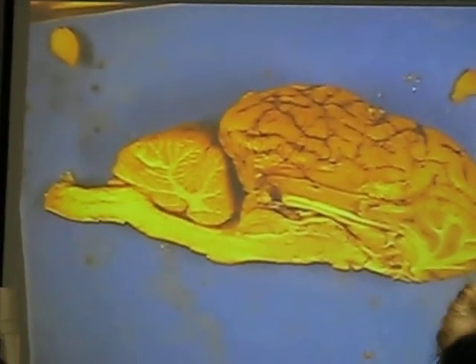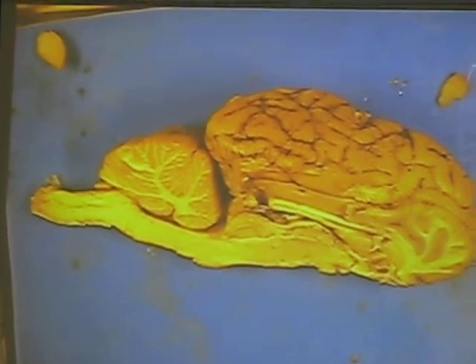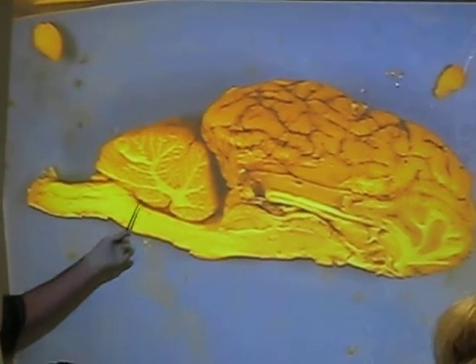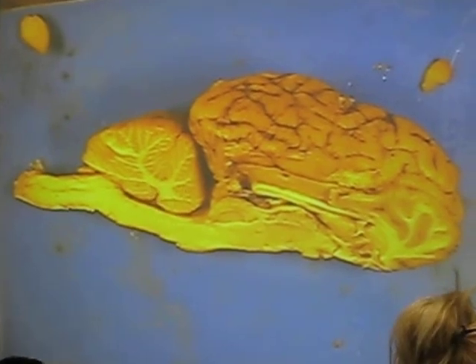On the back, this whole area here is the cerebellum. So you're going to be looking at the cerebellum, and there are a couple of parts you should be able to identify there. Of course, you have the arbor vitae, which is the white matter in the cerebellum. This looks like a little white branching network. Okay, that's your arbor vitae.